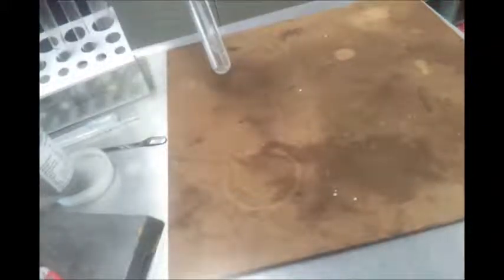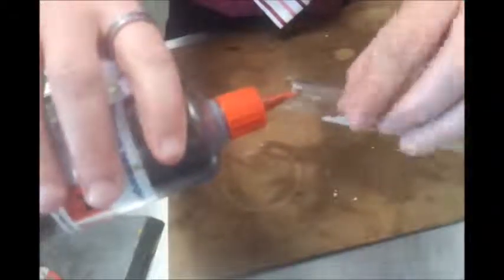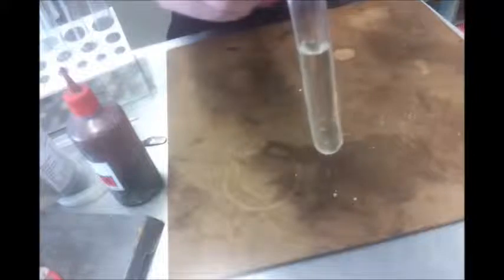And then we're going to add a few drops of potassium permanganate. Now it's hard to see in the bottle here, but potassium permanganate is purple or a very dark pink colour. So I'm going to actually make it sit on the top there so you can see it falling in. When it hits the other solution though, you'll see the colour disappears. But you could argue that's because it's being diluted, and actually really we just can't see the colour. So I'm going to add a little bit more. So it's sitting there. And again, if I shake it, it disappears.